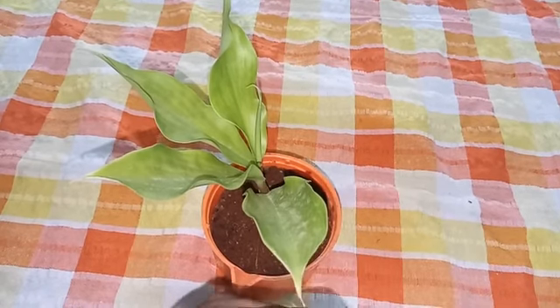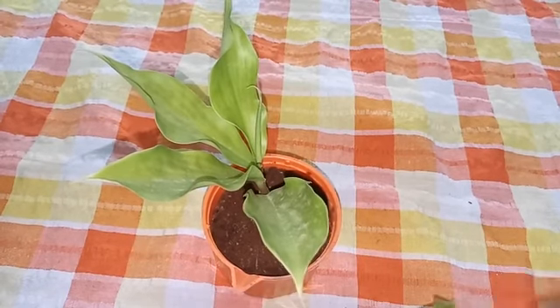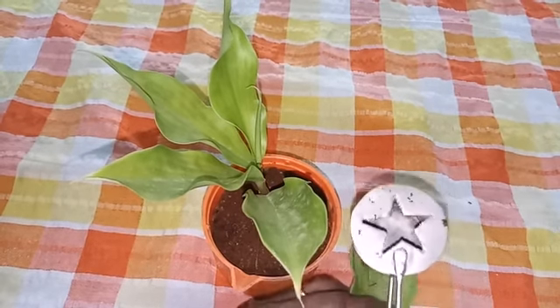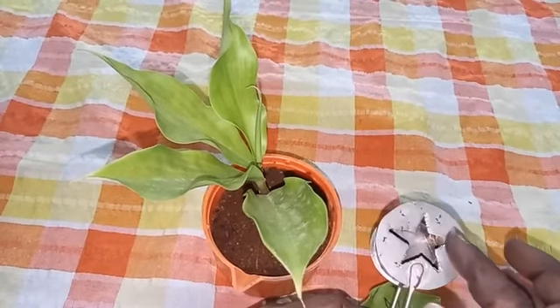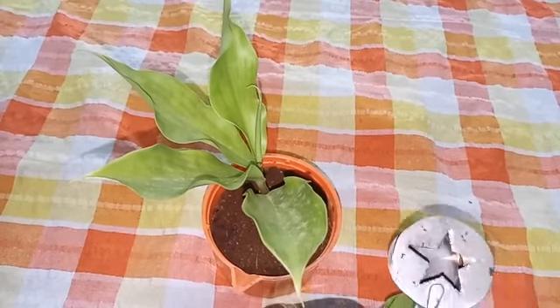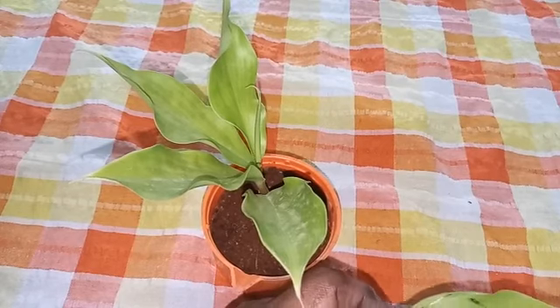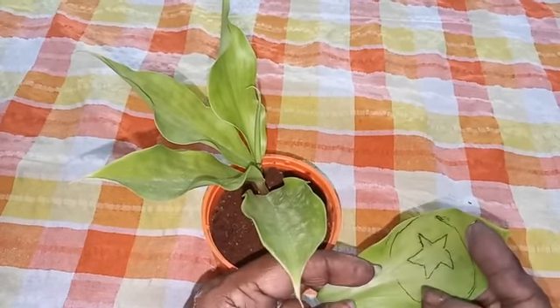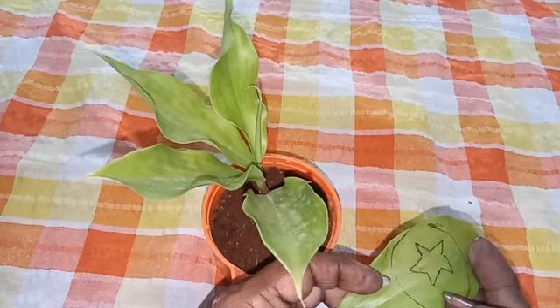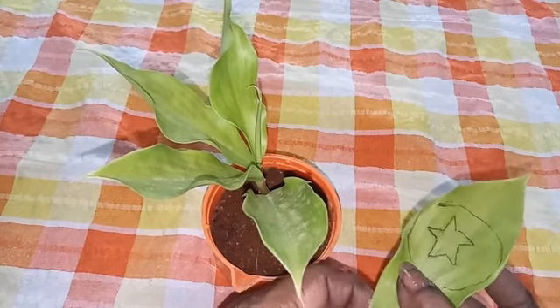But only this portion which is covered with a lid is not getting sunlight, because the lid is blocking the sunlight. So this part alone will not turn blue-black and cannot prepare starch. Photosynthesis will not take place in this part because light is absent. So with this experiment we can prove that light is necessary for photosynthesis.